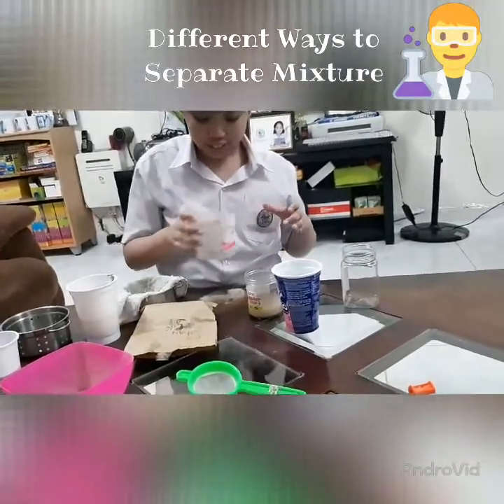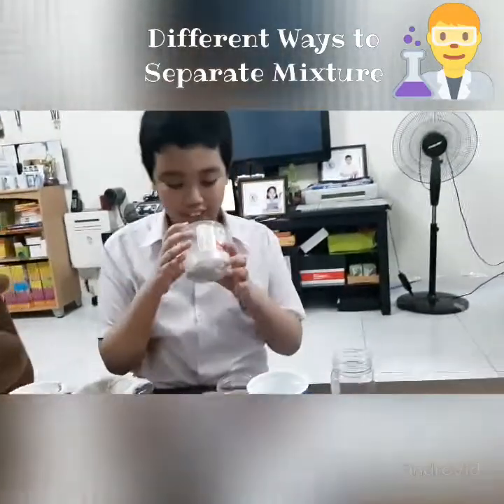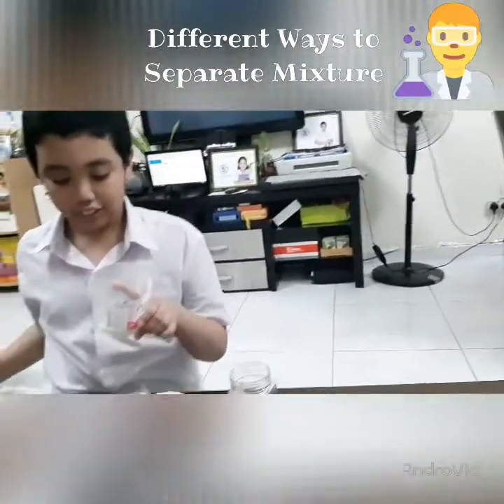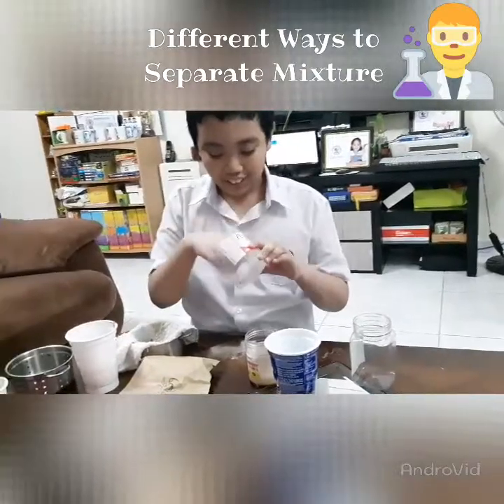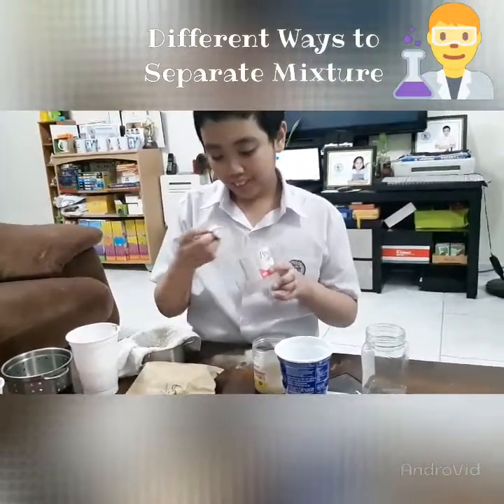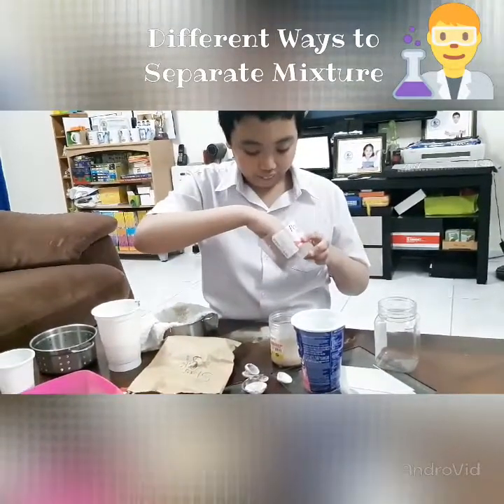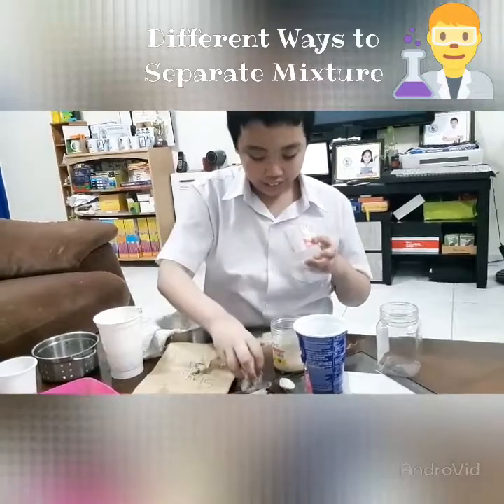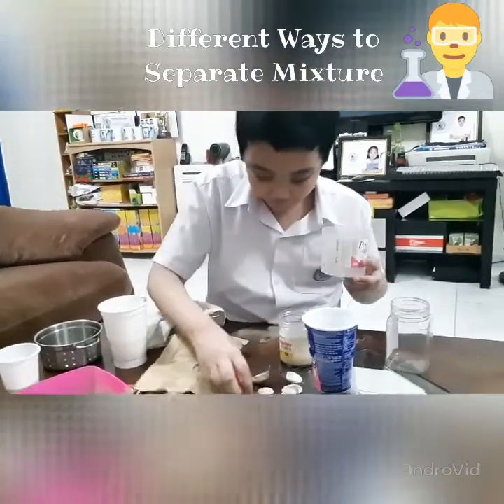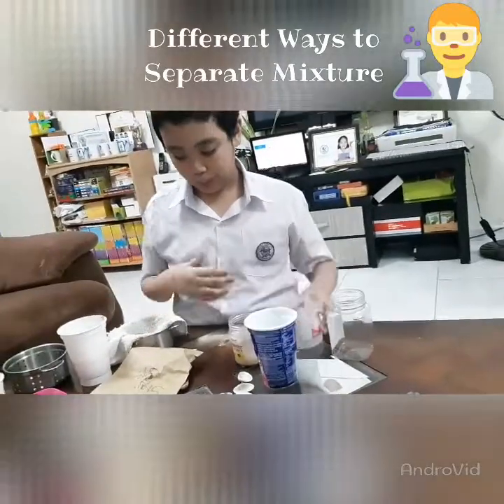And here, now you can see that it's evenly mixed. It's like this heterogeneous mixture. I can separate this by just manually picking, because they're big enough to see and pick apart by the human eye. There, these are all shells, and the only thing left here is paper clips.